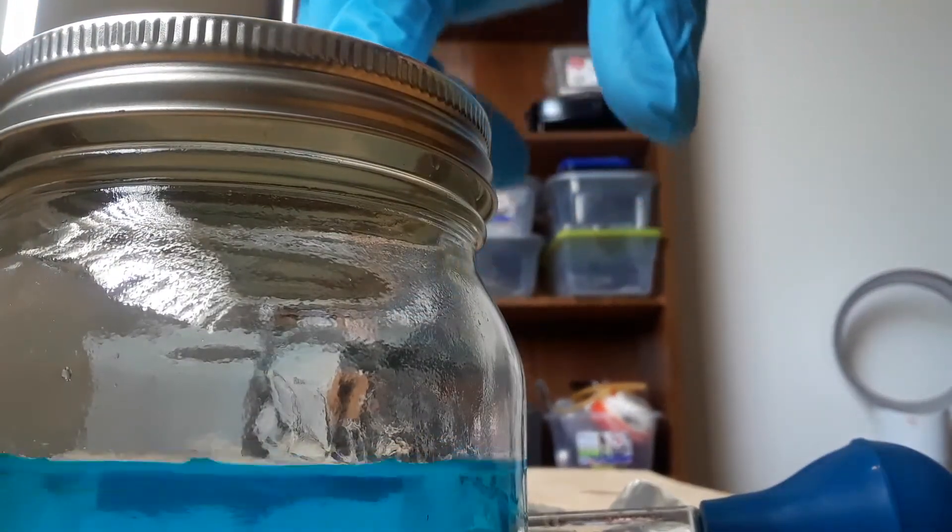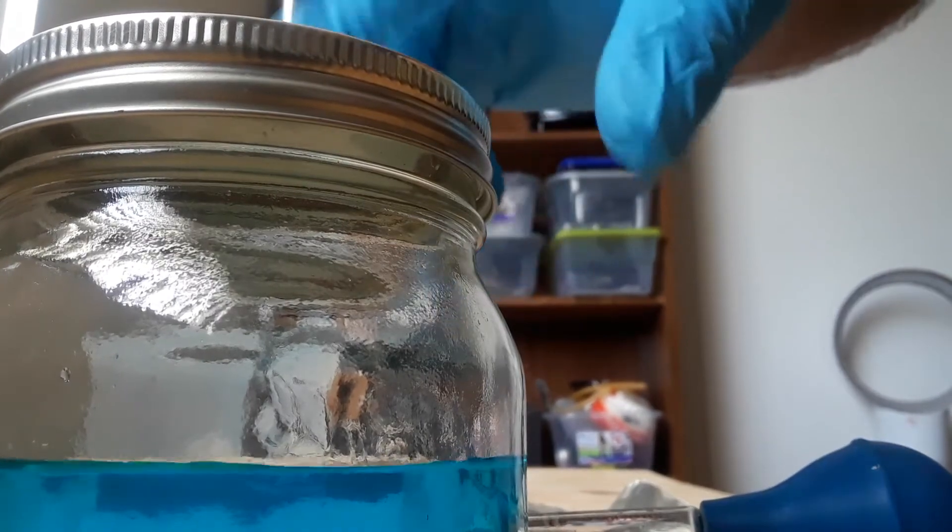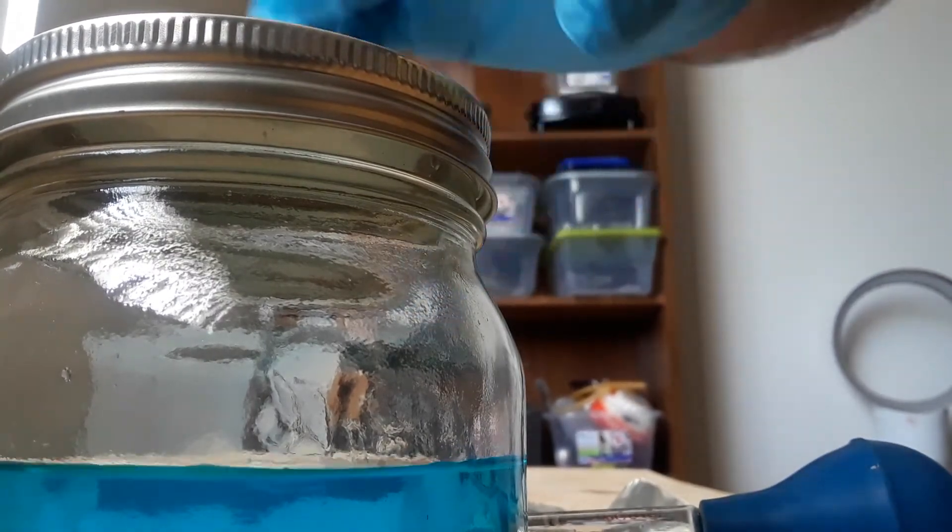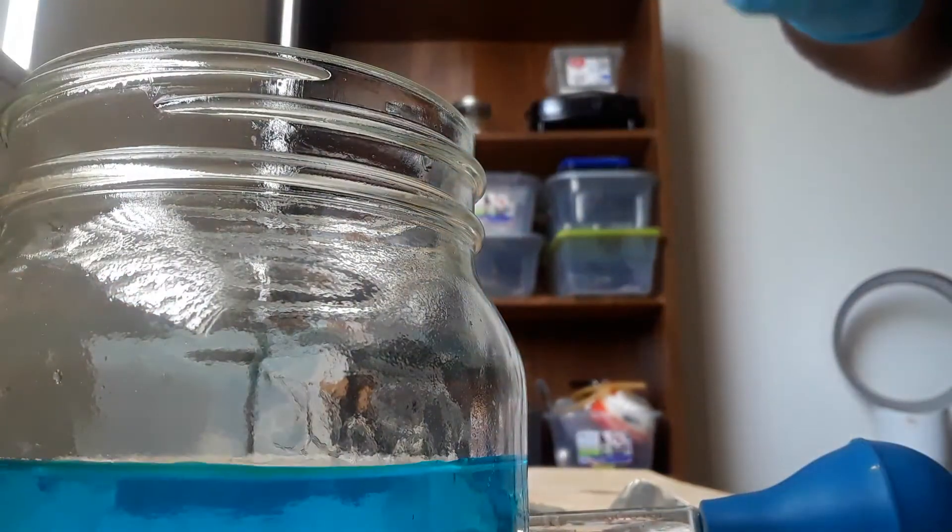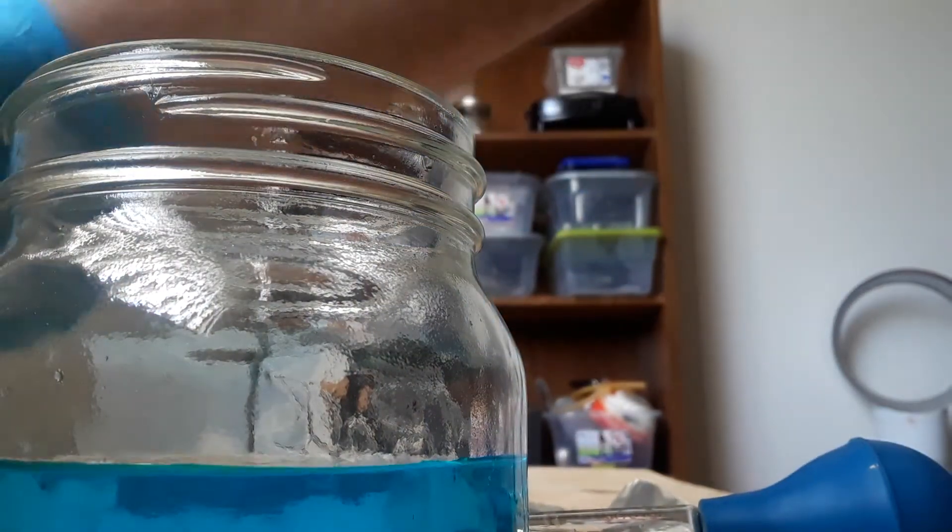The objective for today is to see if I can precipitate out the copper along with the zinc, and hopefully just reduce the copper oxide back to copper metal and remove the zinc impurities.